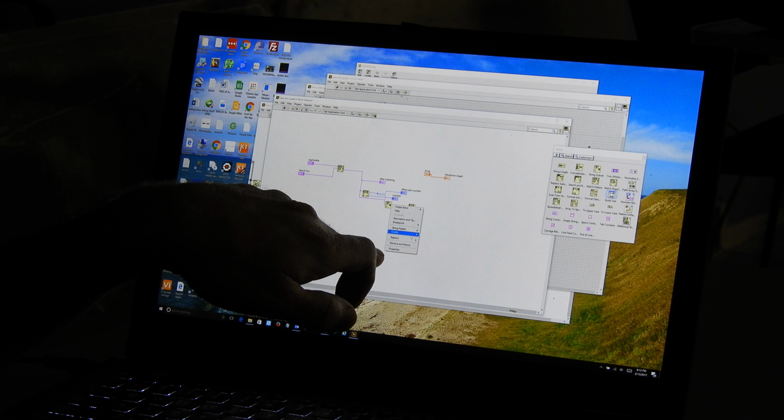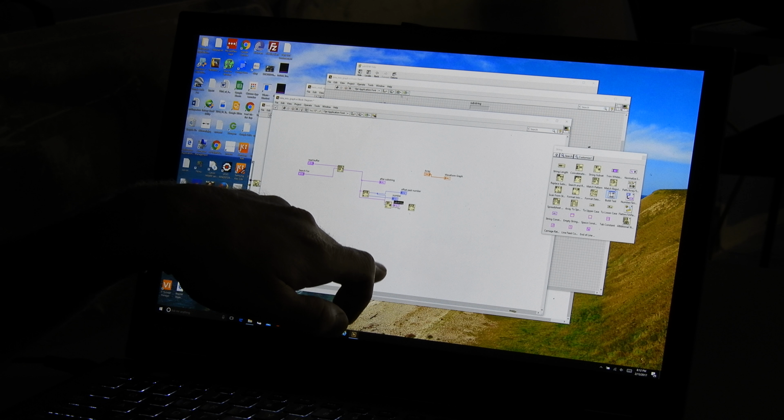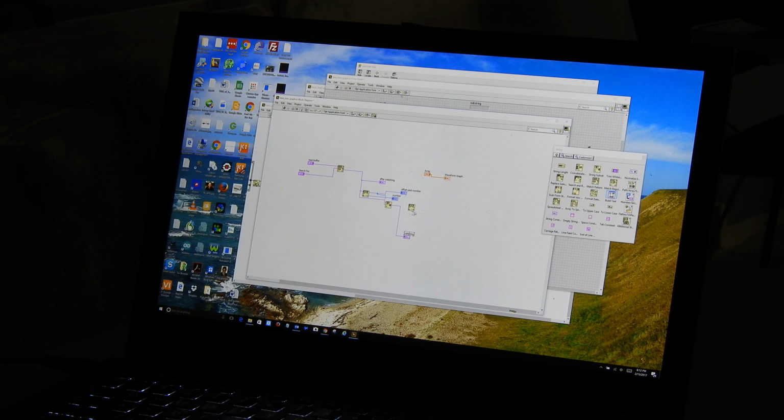I'm going to create an indicator just so I can see that this is what's happening. And I'm going to feed this value into the fractional part. And then we're going to take a look and see what kind of number we get out of that. Create indicator here. This is our number coming out. Offset past number. We're going to create that as an indicator. Okay. Now let's take a look and see what we got.